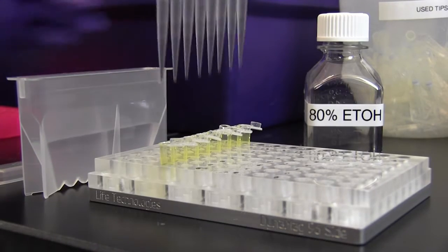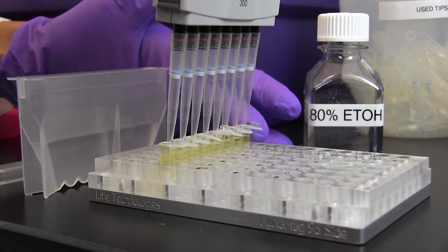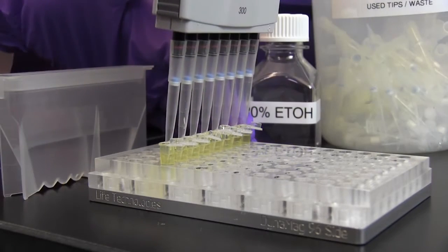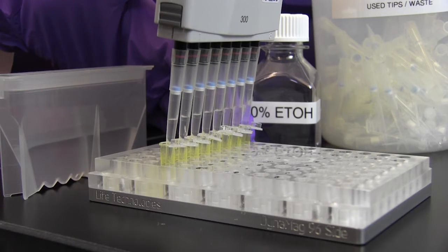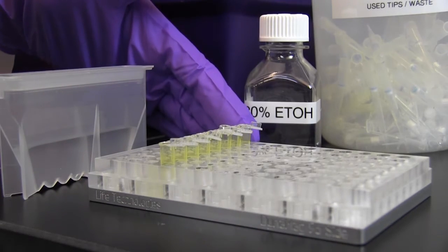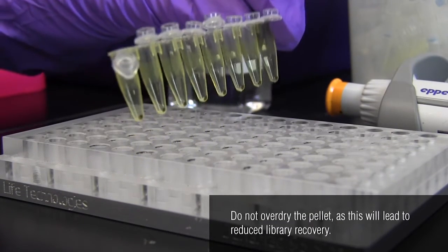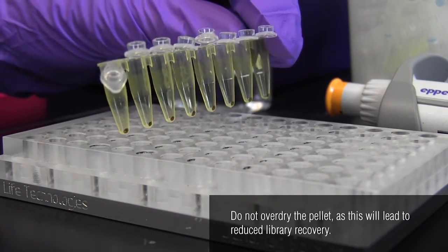Wash the beads with 200 microliters of 80% ethanol while they are in the magnetic field. Incubate for 30 seconds at room temperature and then remove the ethanol. Repeat this wash step once. Allow the beads to air dry while the beads are in the magnetic field but avoid over drying the pellet.